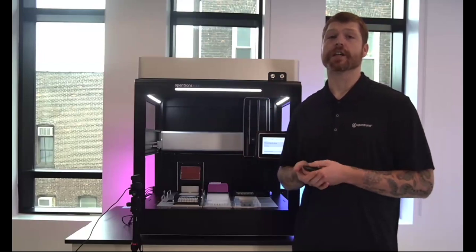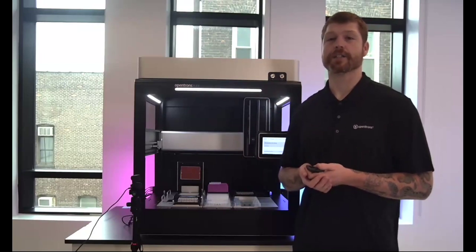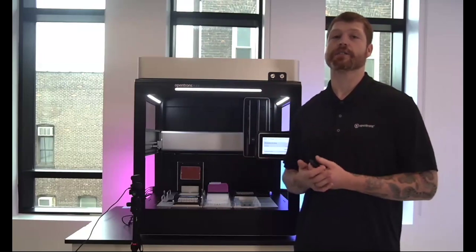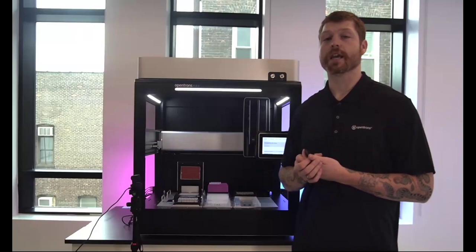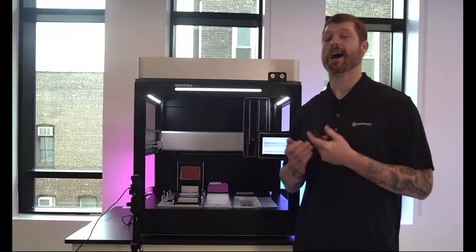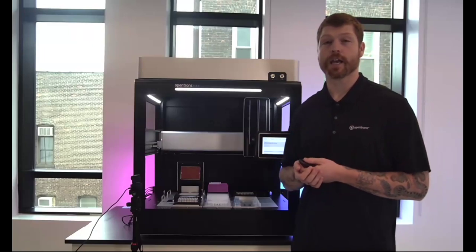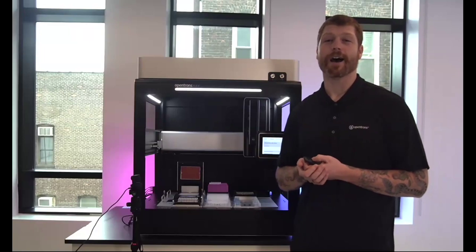But the new features here, which are very exciting, we're really, really excited to get these into the hands of our end users. The first is going to be the ability to now change our error behavior. So instead of canceling a run, the new behavior is going to be to pause a run at error. I will hopefully not be demoing this today. If I do, it's totally accidental, but we'll see how it works.